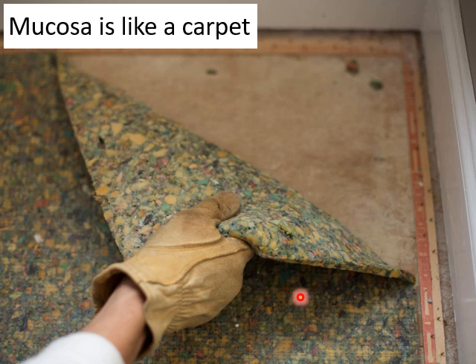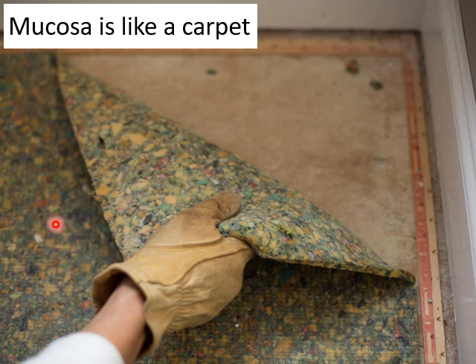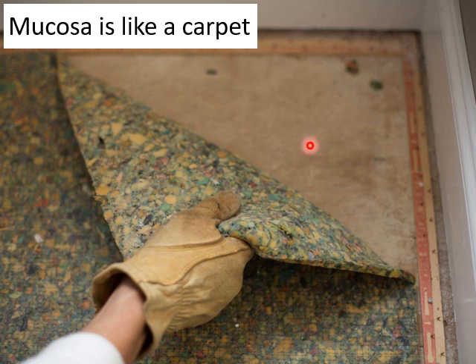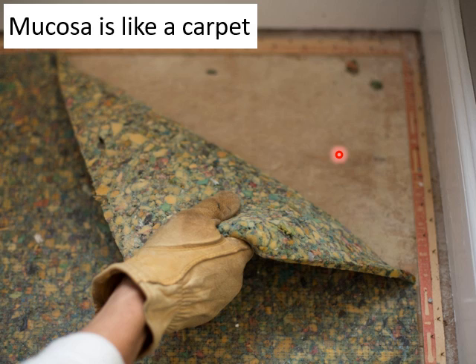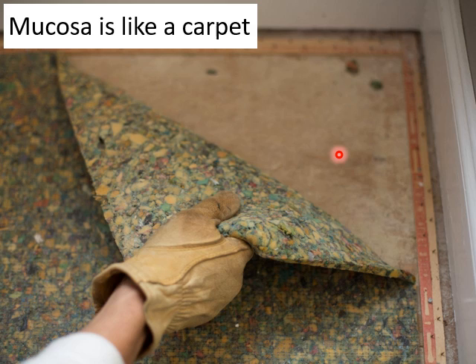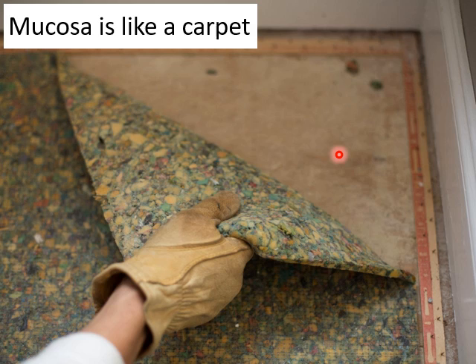The mucosa can be thought of as a carpet that could be peeled off, with the most superficial epithelial cells on its surface. The submucosa lies beneath it, then the bronchial wall or cartilage, then the adventitia or serosa. The mucosa is always the innermost part of any hollow luminal organ. Importantly, the mucosa includes not just the epithelial cells but also the underlying supporting stromal material beneath the epithelium.